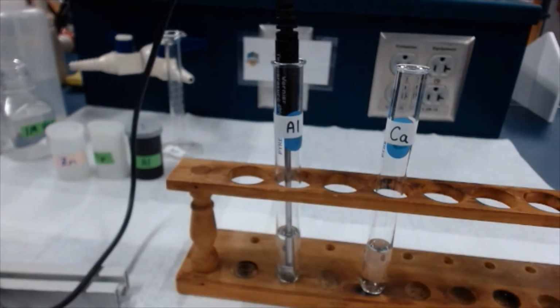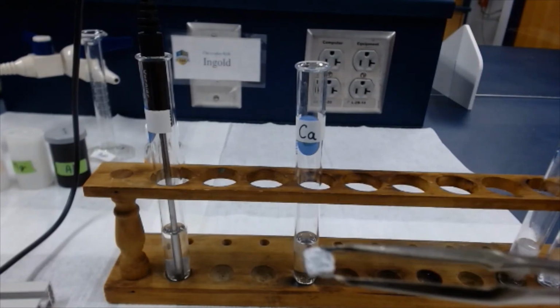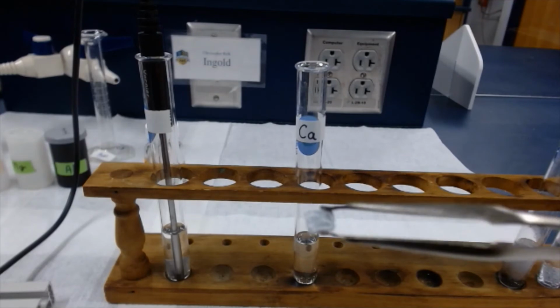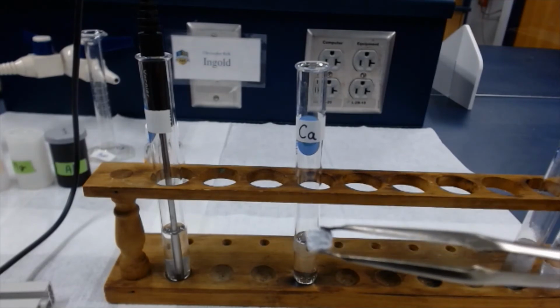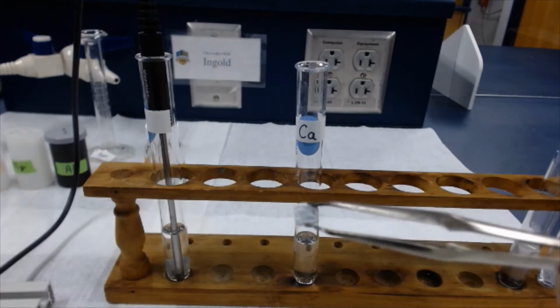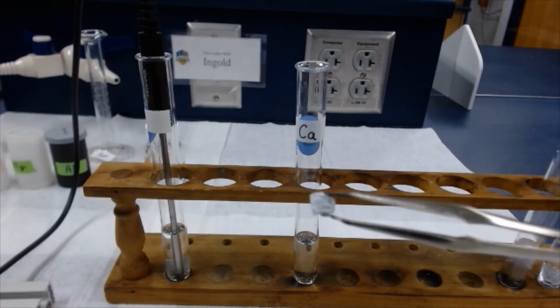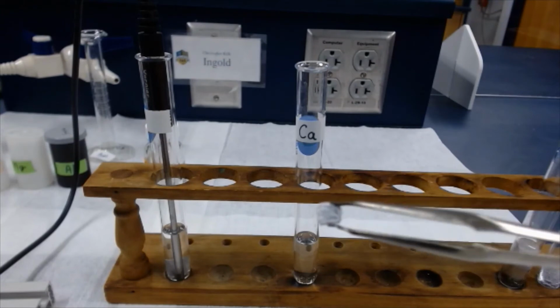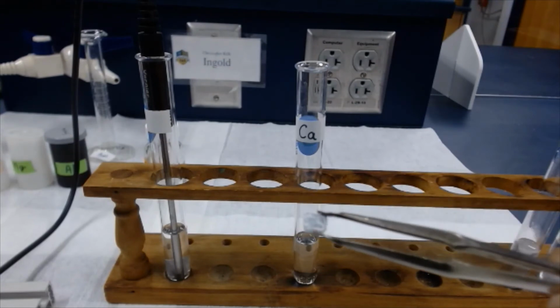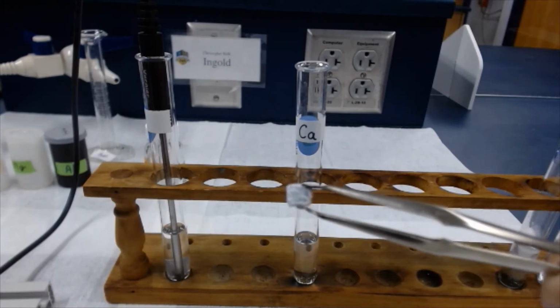Okay, class, let's throw in the calcium. Calcium comes in these kind of lumps. Now normally it's a little bit of a dull gray. Sometimes the calcium, when it sits out, gets a white coating on its surface. The calcium actually ends up reacting a little bit with the oxygen in air to make calcium oxide, and that's the whitish stuff that you see on the outside. But calcium is a metal, and usually, if it hadn't reacted a little bit with oxygen in air, it would be that dullish gray color that you see beneath that white.